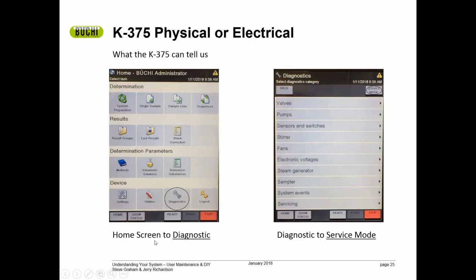Okay, that was a great video showing you how the system works. I'm sure you're familiar with the system and working in your lab. Now let's take a look at what the K375 can actually tell us. We're going to look at the K375 primarily because that is our current model, and it has many helpful parts in the software that help you diagnose problems or issues.